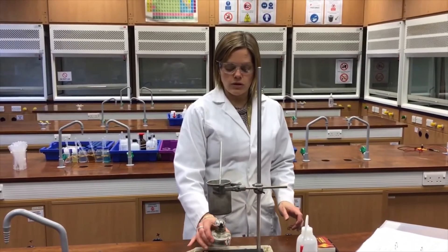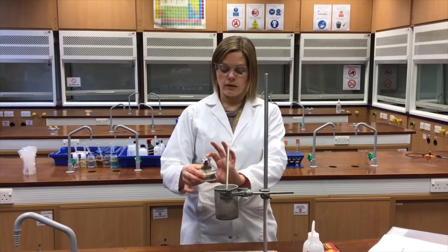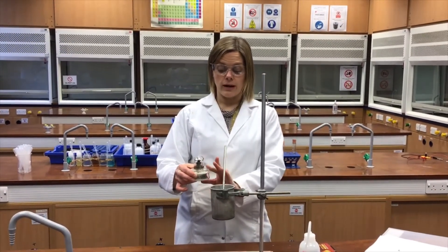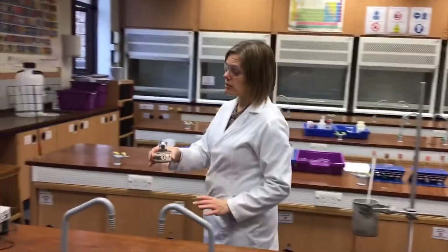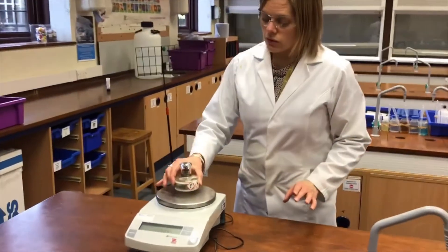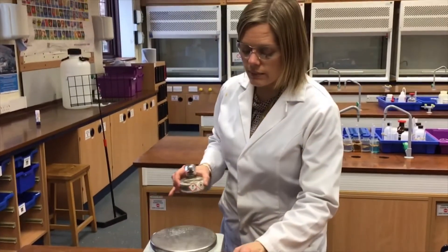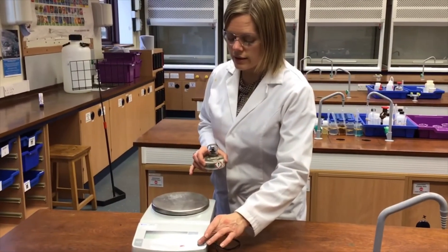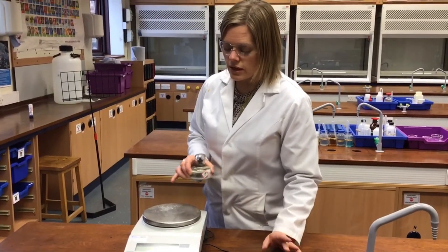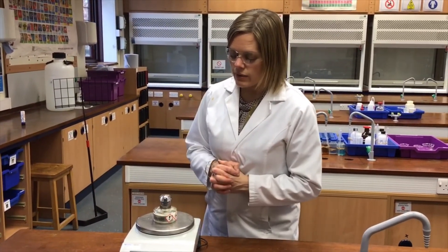I can now take the spirit burner over to the balance and record its final mass. I'll re-tare the balance as it has drifted slightly, then place the burner on top to record the final mass.